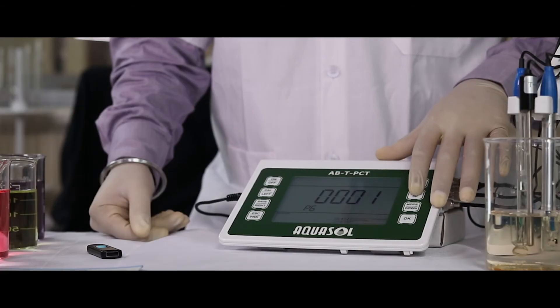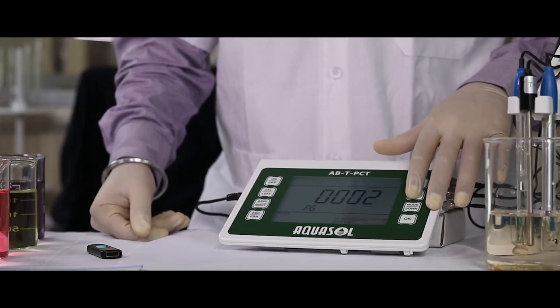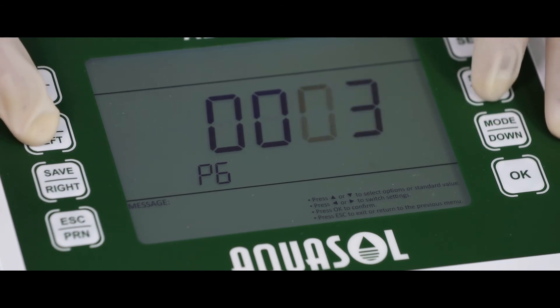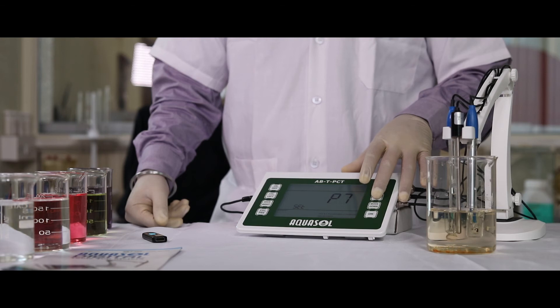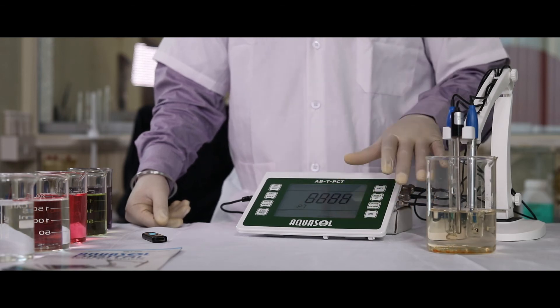Press up and down key to change values and left and right arrow keys to shift variables. P7 factory reset.